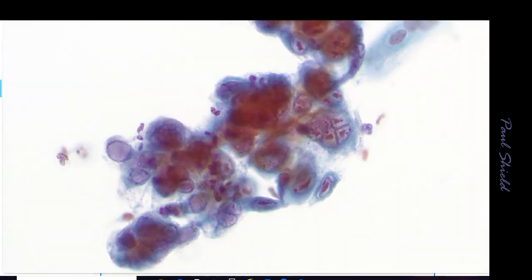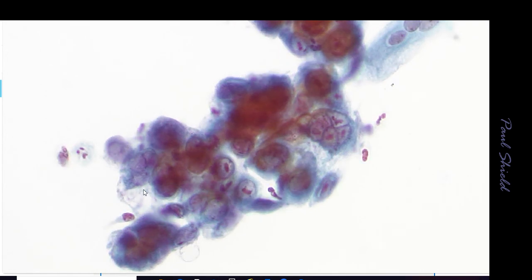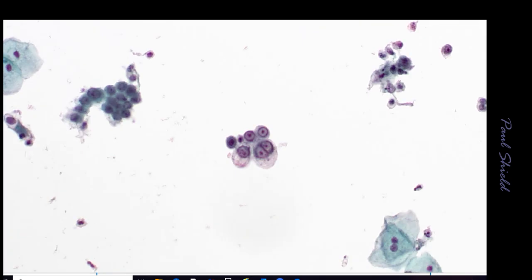This one's a little different, so it's showing the eosinophilic single inclusions in each of the nuclei. You don't always see that. People say it's more commonly seen in secondary infections, but notice how the chromatin's still marginated, so it's really glassy looking. So there's no granularity to that chromatin at all. When you do see these inclusions, there's another group here. They can look like large nucleoli, so some normal gland cells there.